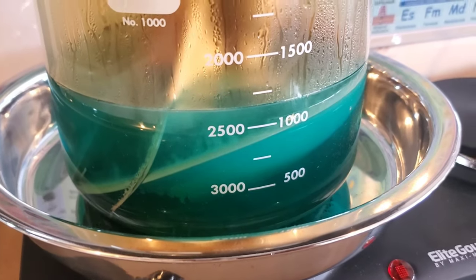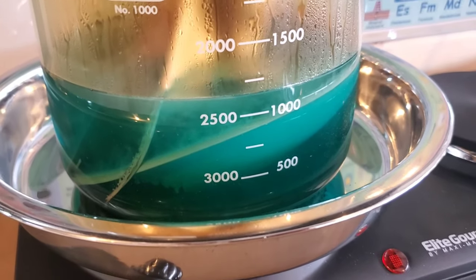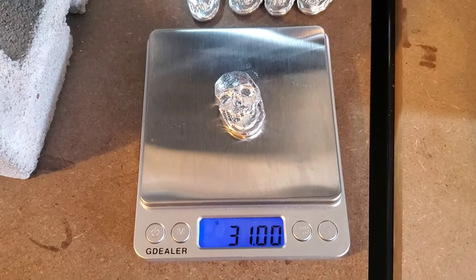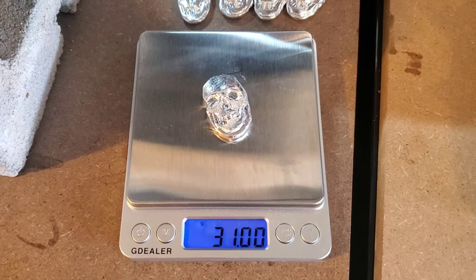All right. Elapsed time is now 1 hour and 20 minutes. And as you saw a second ago had time for one more pour. This one came in right at 31 grams.